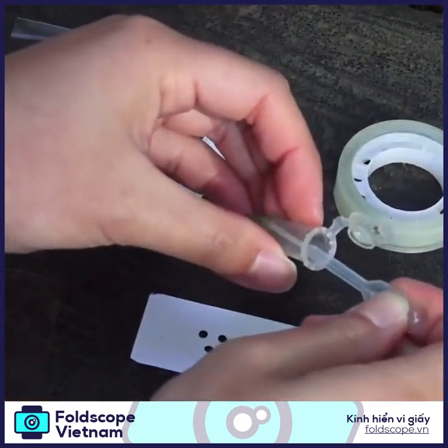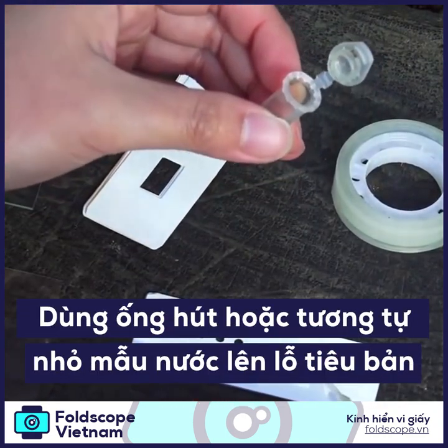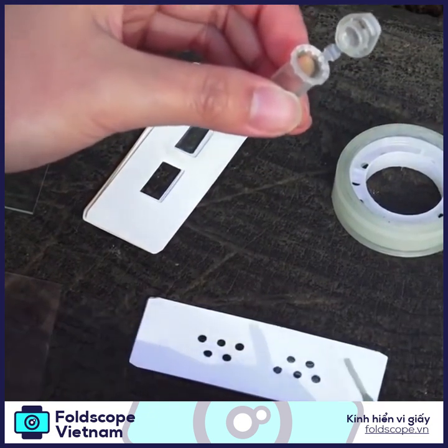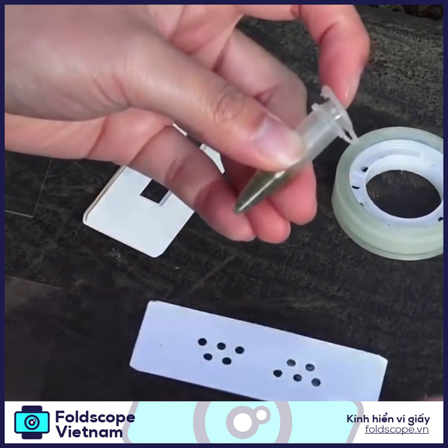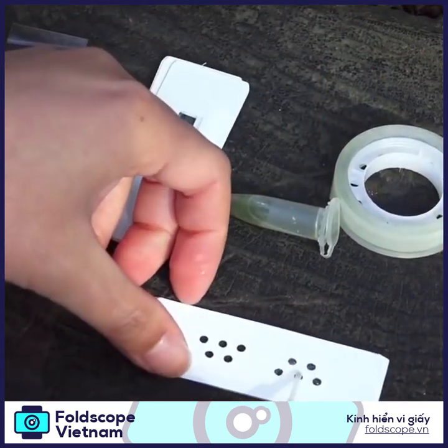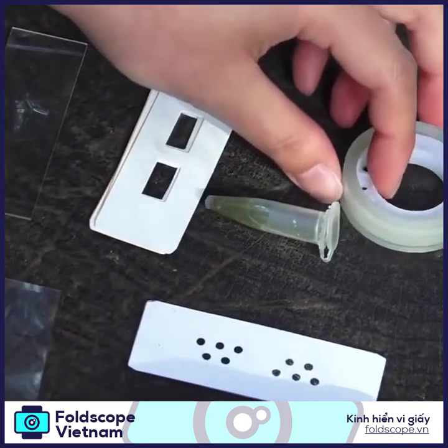Take a little bit of water sample with a dropper and place just a tiny bit on the micro wells. Tiny bit goes a long way. You might even want to spread that around a little bit.